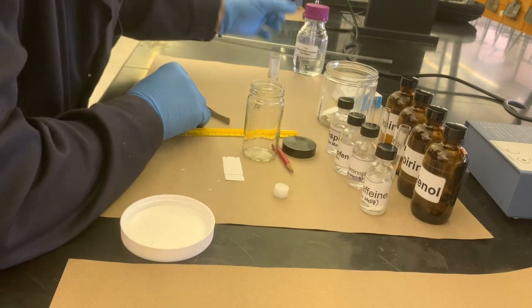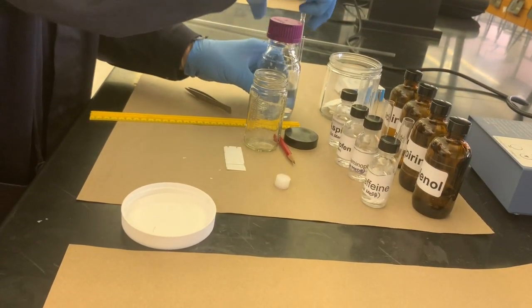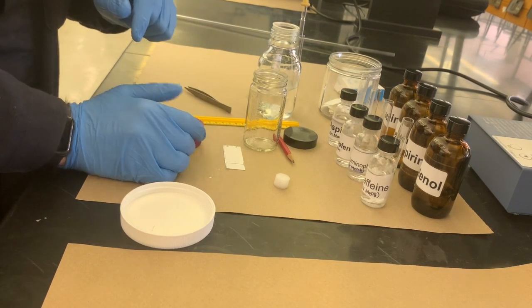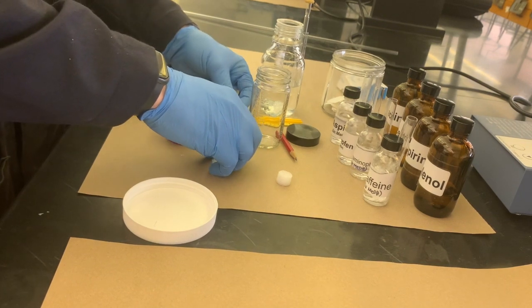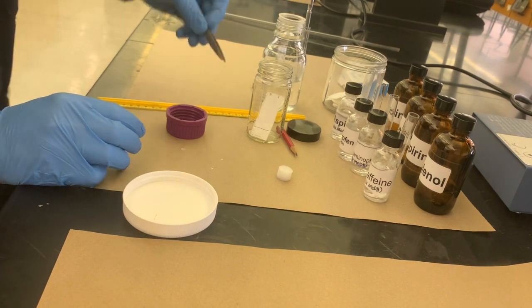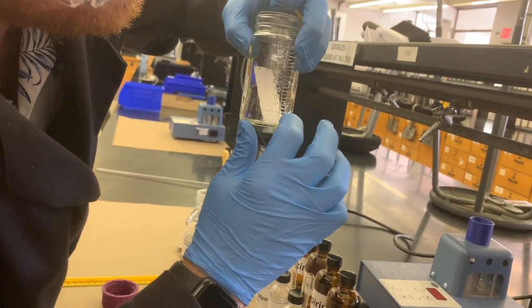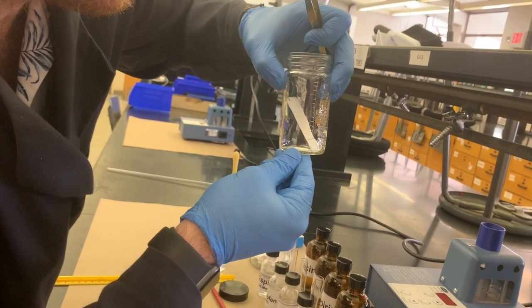So you want to make sure that you add enough of the eluent first in order for everything to be ready to go. And once you put that TLC plate in, it's go time. I'm actually going to put it in for a second only because I want to see how high I should make that eluent. I don't want the eluent to be any higher in the jar than below where the samples begin because it'll prevent any kind of washing over the samples and cross-contamination.